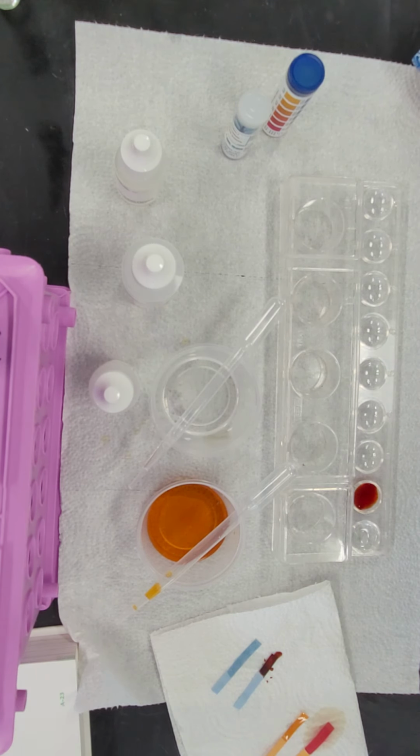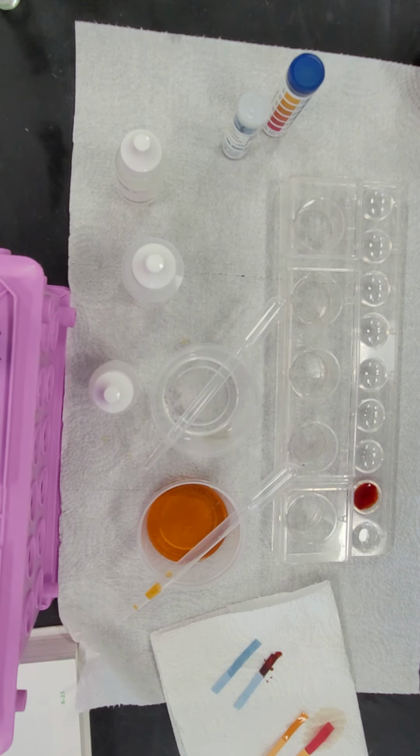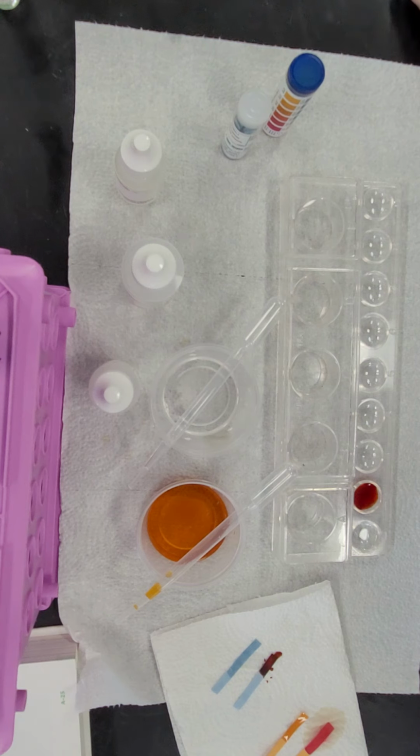So based on this information, you should look in your book and identify what the substances are and document that on your 5.1 sheet, the sheet that we started in activity 5. When you started identifying the physical properties, you're going to document that in the characteristic properties for the chemical side. And tomorrow we'll look at flammability.